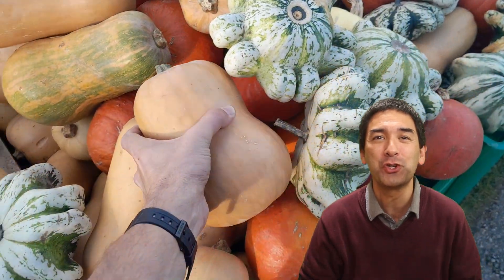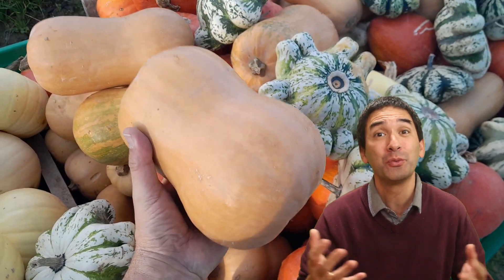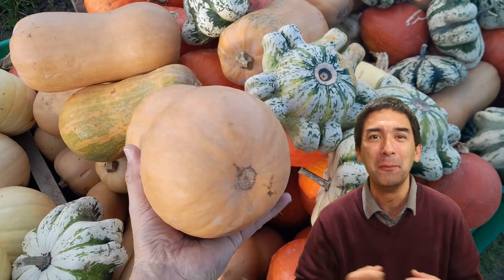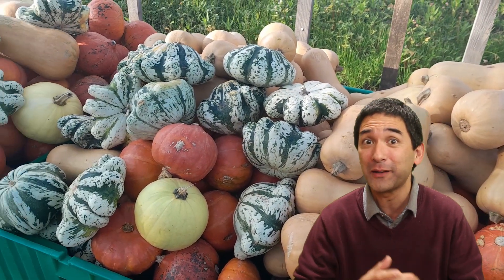Today I want to find out why pumpkins give us so much energy. Pumpkins are very nutritious and energy-rich, but why is that? Well, I'm going to put a pumpkin today under the microscope. Yes, under the microscope.